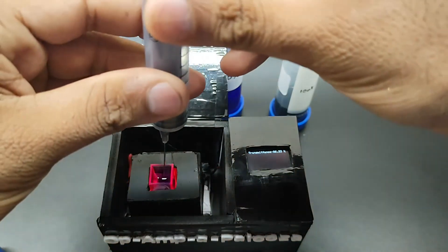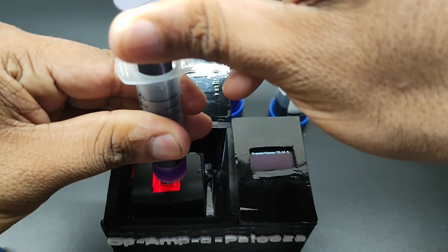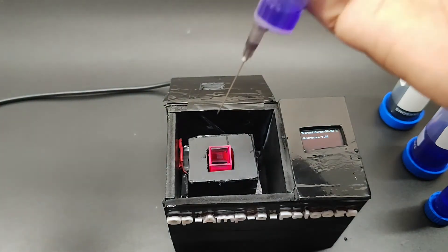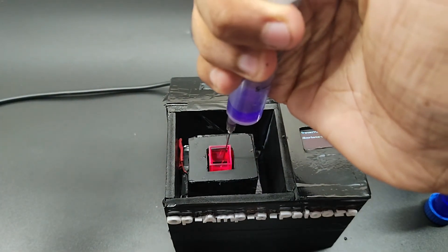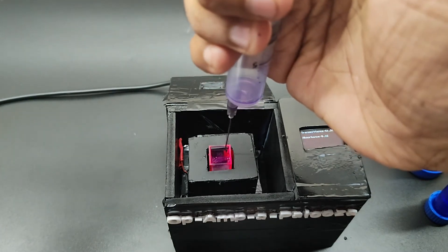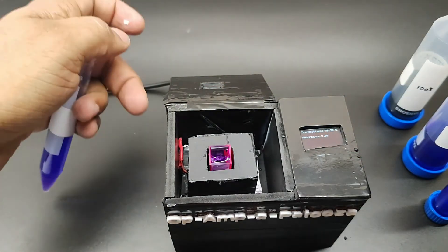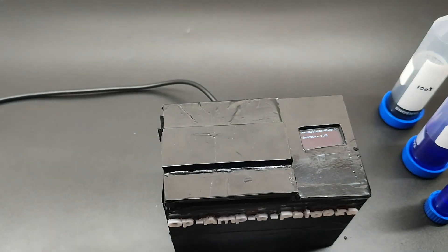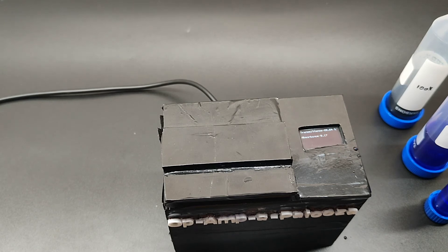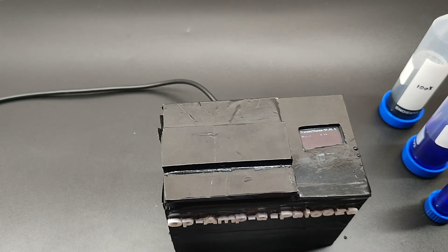Now I will remove the liquid and add the 50x solution. You can see 61% transmittance of light is shown, and the absorbance is 0.19. I will note that down.